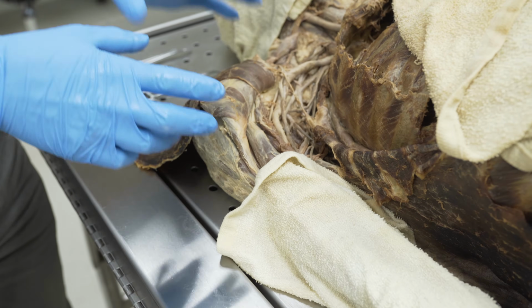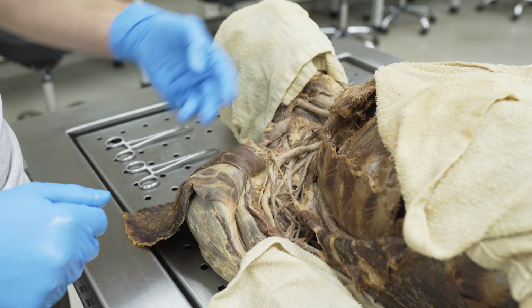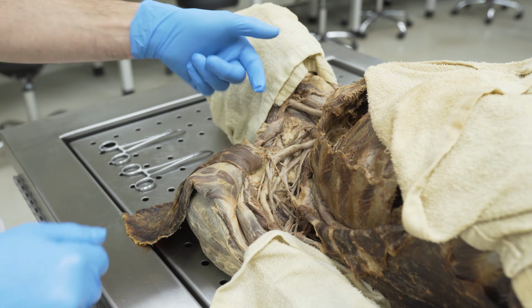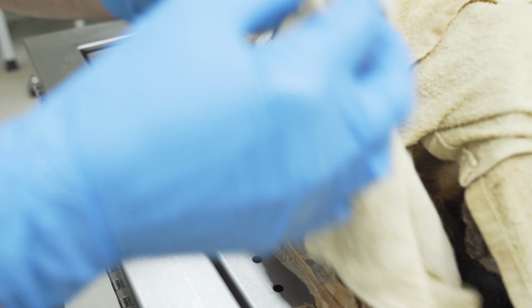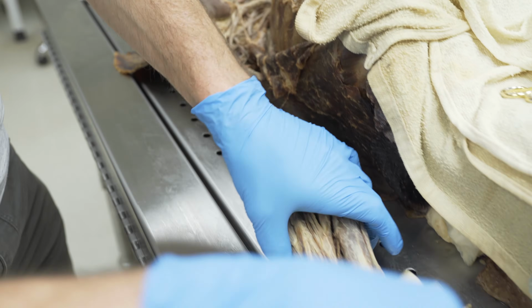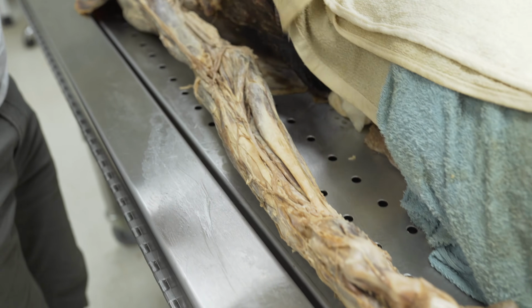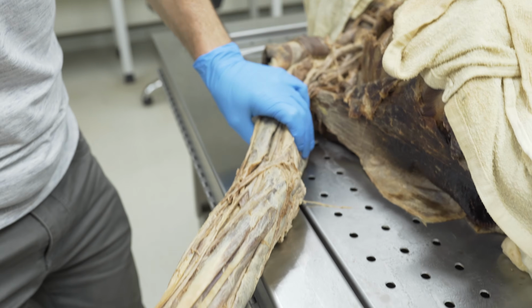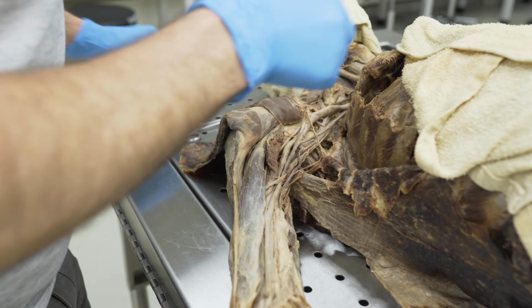All right, we want to follow some of those nerves further down. So we found our five. We had the three that made up the M shape, and we had the two that were a little deeper. We're going to trace them down. So let's uncover the upper extremity here. We'll uncover all the way down here. All right, let's bring the arm out a little bit like this.